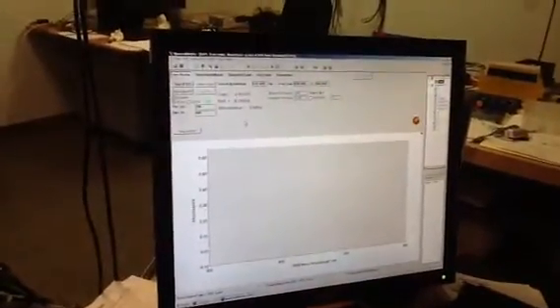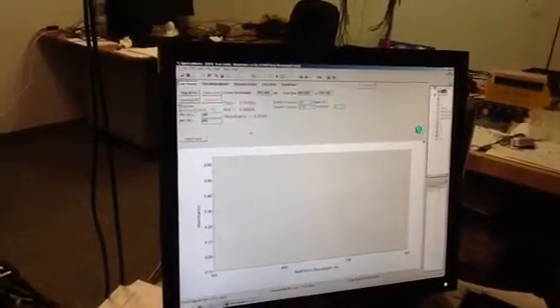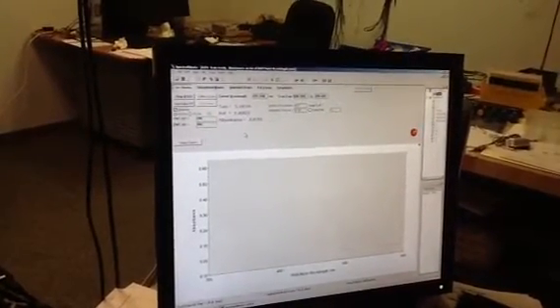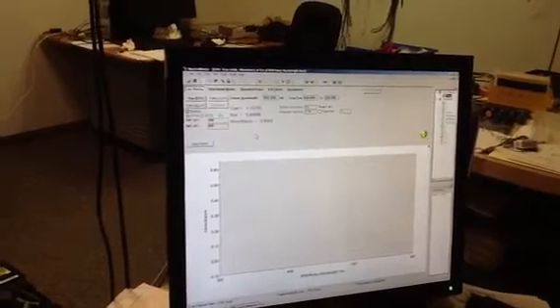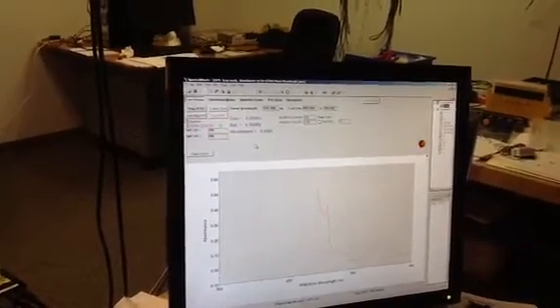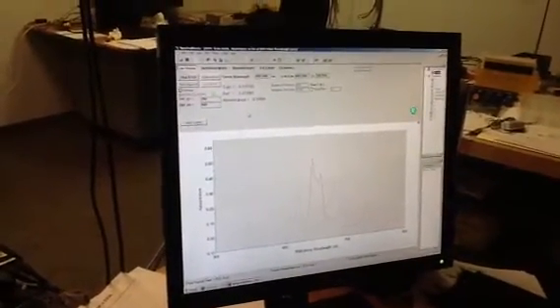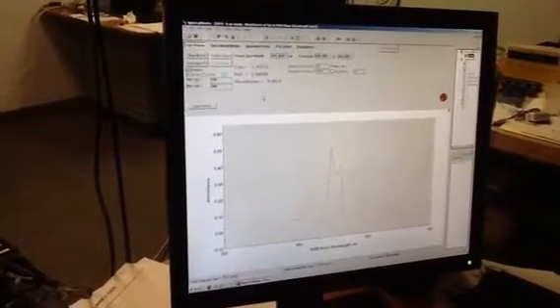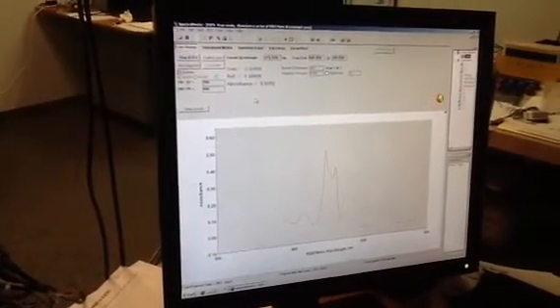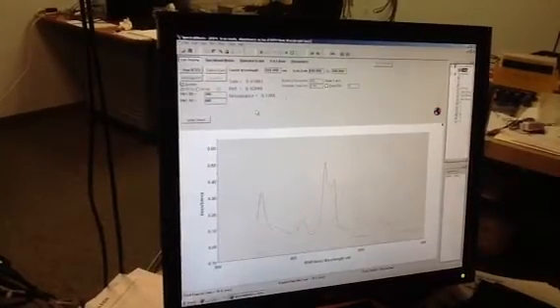And instead of the nondescript high absorbance value that the diode array was able to collect for us, the CLARiTY is in fact going to be able to find all the characteristic peaks of this metal oxide nanoparticle suspension and do so quite easily in a sample much more turbid than you would ever successfully use on another instrument in your laboratory.